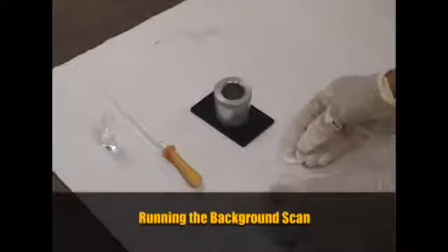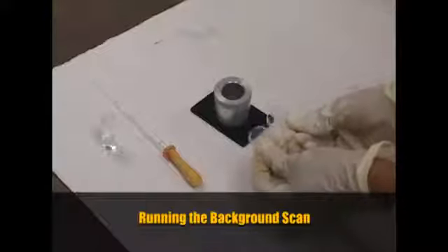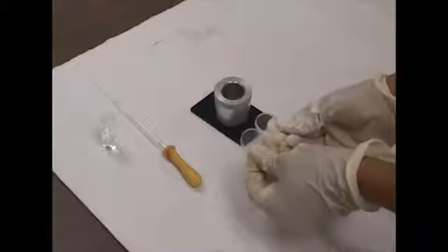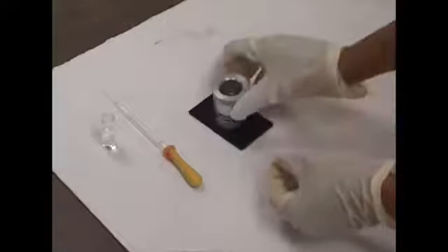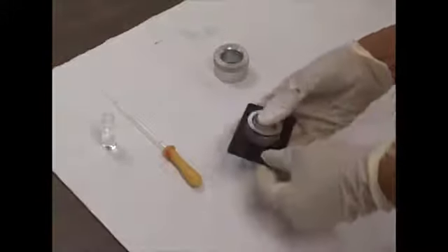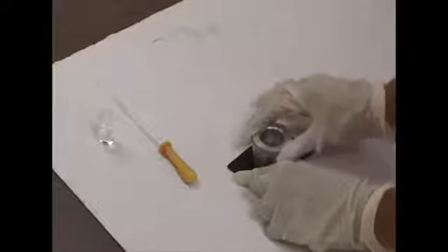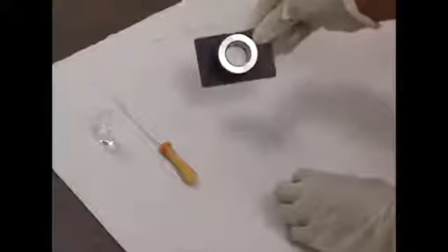Transparent discs, or salt plates, are used for FTIR, and they're made of sodium chloride. They're very fragile. So the first thing that we're going to do is to sandwich them together and place them on the salt plate holder. And carefully we're going to put the top of it, applying a little bit of pressure without cracking the actual plates. So this is how they look.